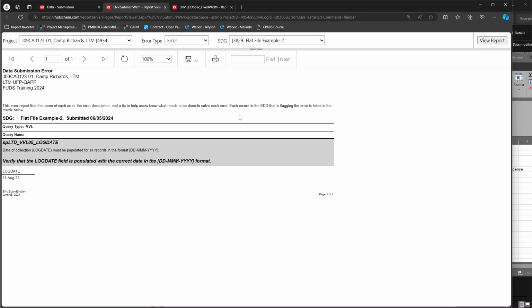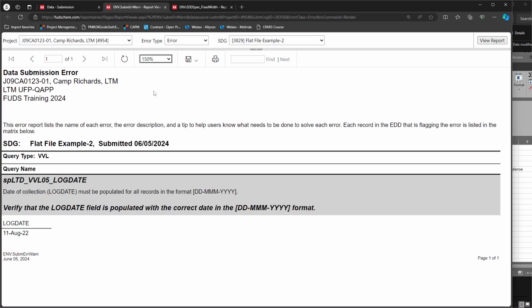We'll troubleshoot the log date error. This error says that the date must be populated in a specific format. Below, we can see the date that does not match the required format. In this case, the year only contains 2 digits instead of 4. This error is common for flat files because Excel uses a different date format by default, and reformats dates automatically whenever files are opened for editing.